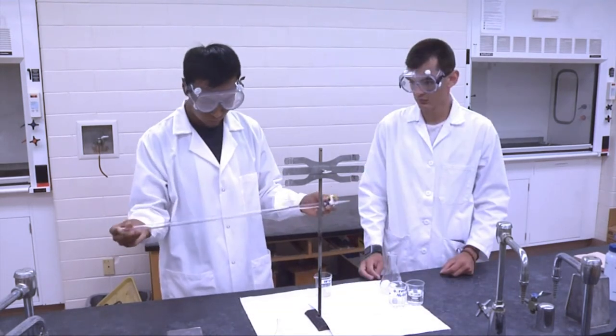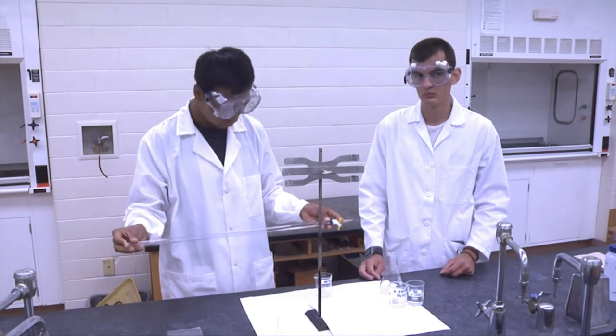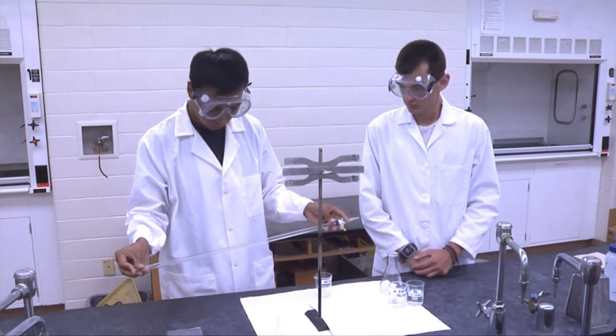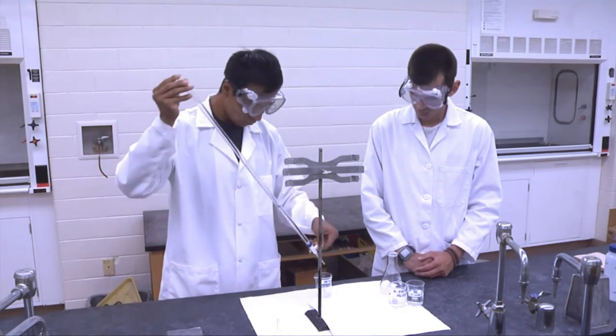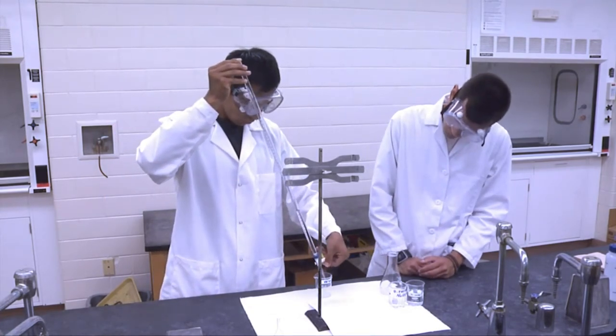When rinsing, make sure the rinse contacts the entire internal surface of the burette. Empty the rinse into a waste container.